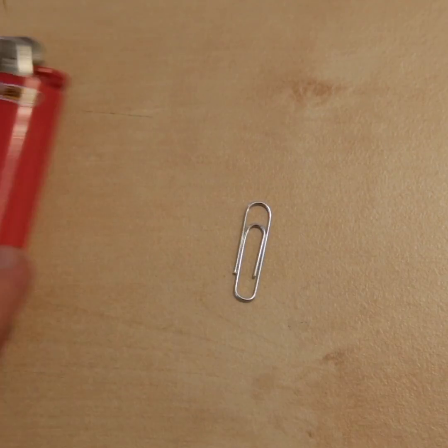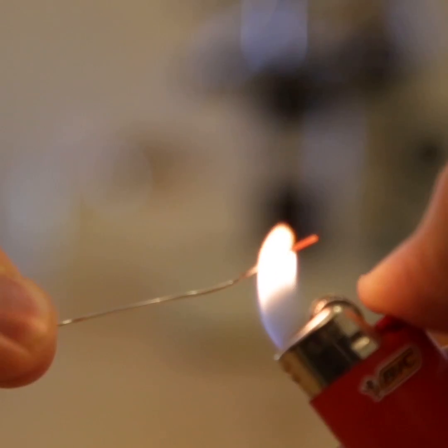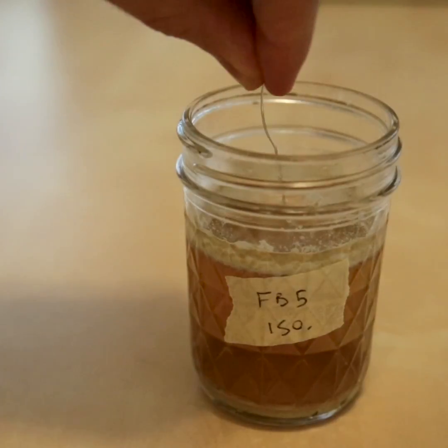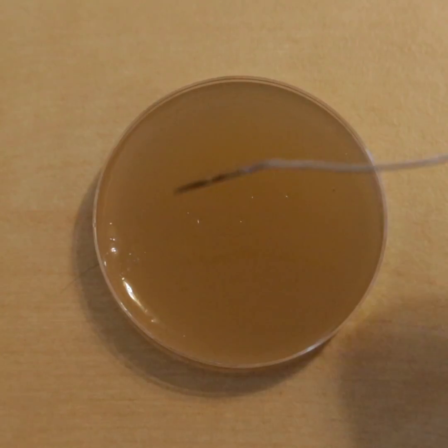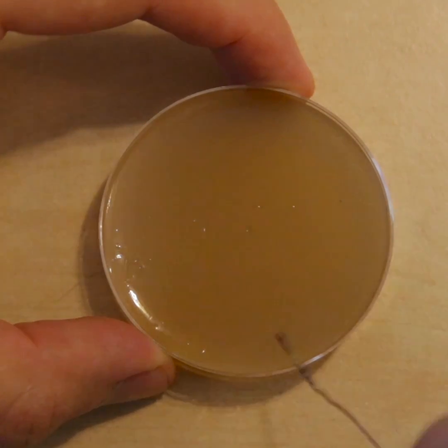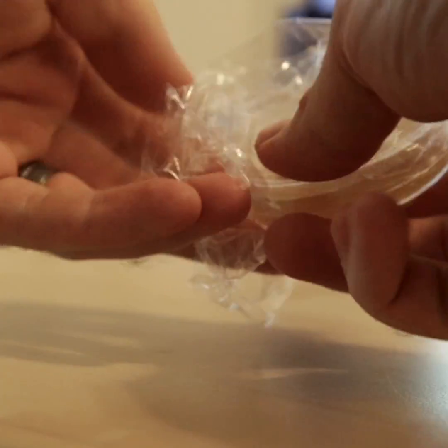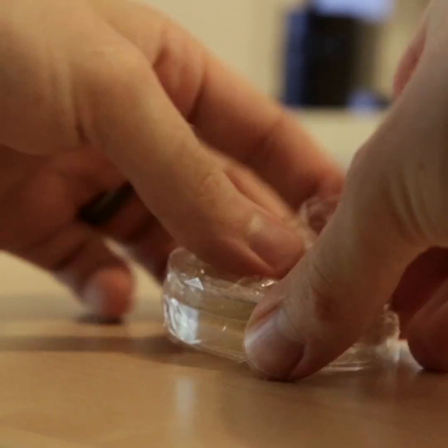When you're ready, you'll need a couple more very important pieces of scientific equipment — a high-tech metal transfer tool and a source of fire. Sterilize your paper clip by holding it in an open flame until it's glowing red. Once the paper clip is cool, you can insert it into your sample of starter yeast and then streak it across an agar plate. When you're finished, wrap it in saran wrap to make sure it stays super clean. Put it in a dark room temperature space and let the yeast get to work.